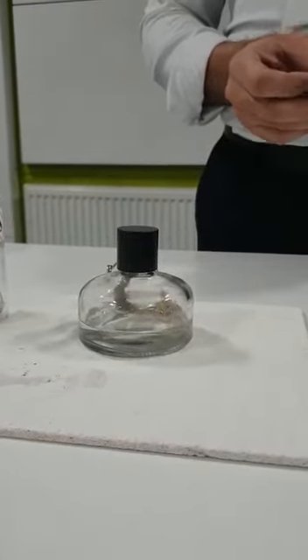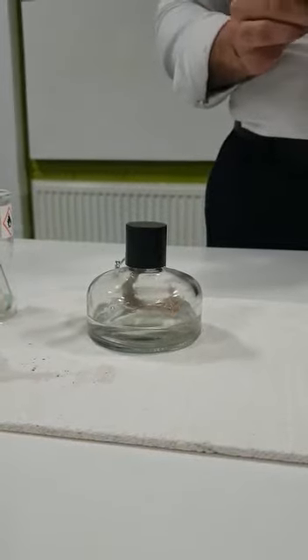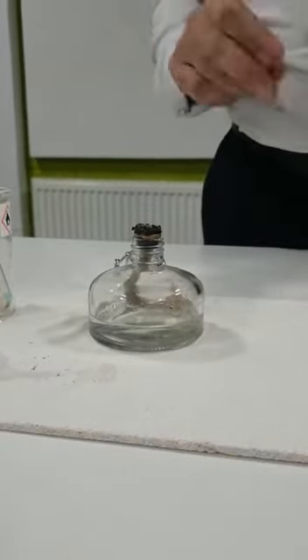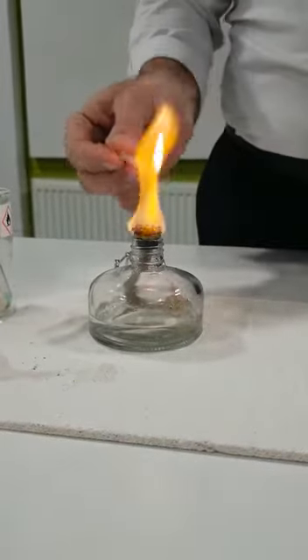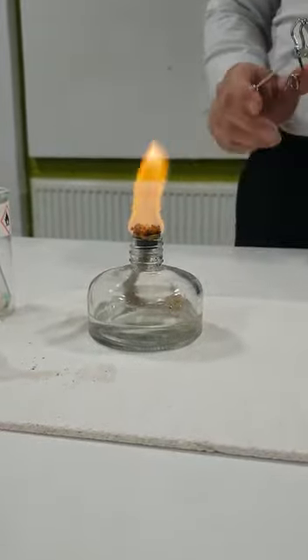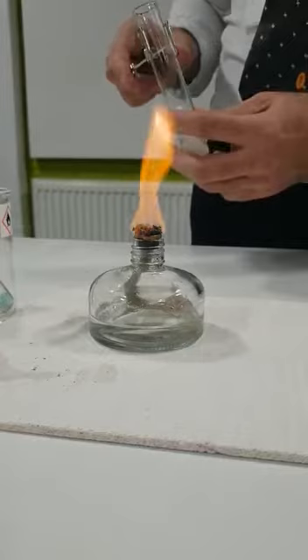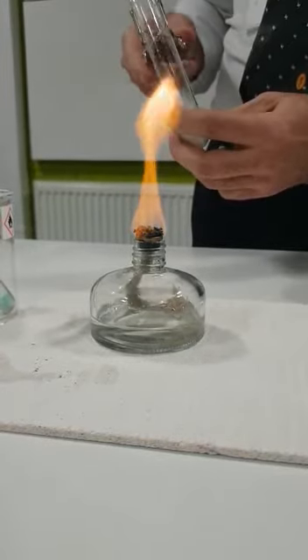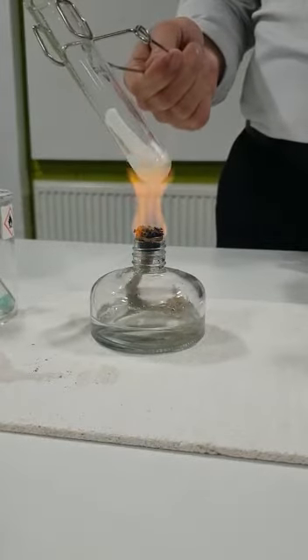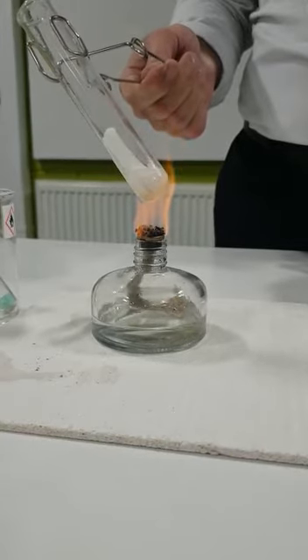For safety, use your goggles the whole time during this experiment, and we're going to turn on the burner. I will do this for you for each group, so you don't need to worry about turning it on. Once you make sure you have your goggles, you start with the ice. Take the test tube with the test tube holder, and this one includes some ice. You keep it above the flame.